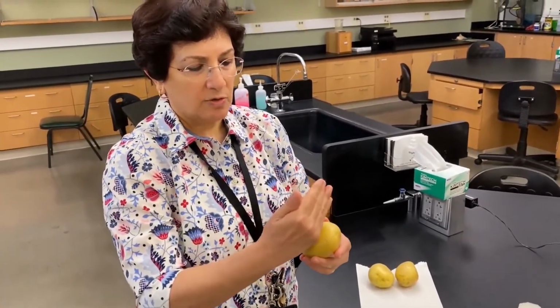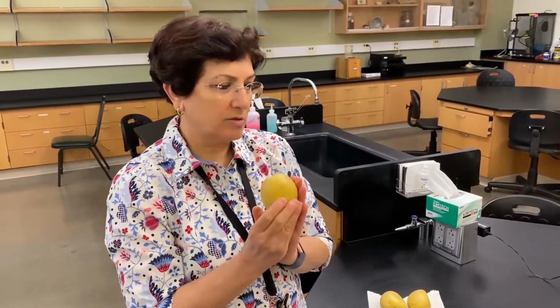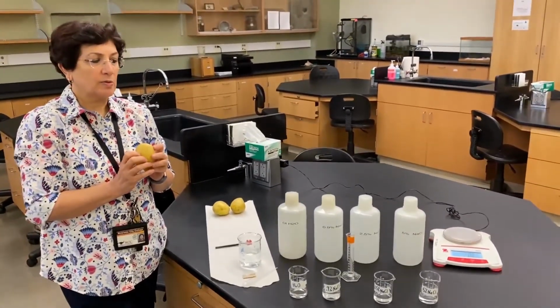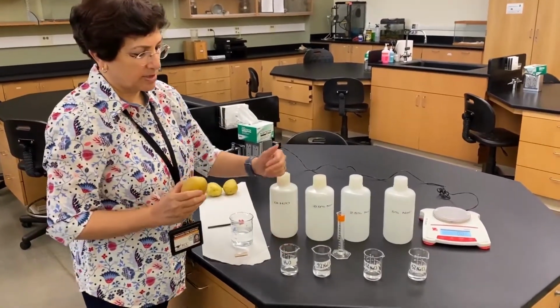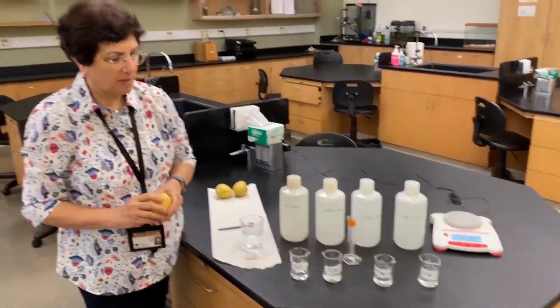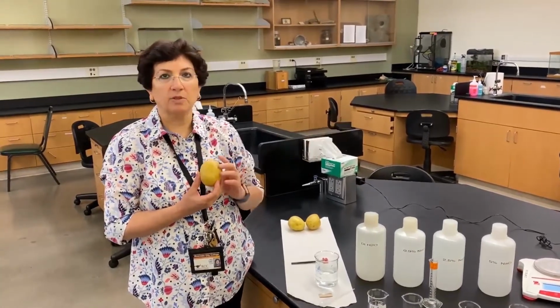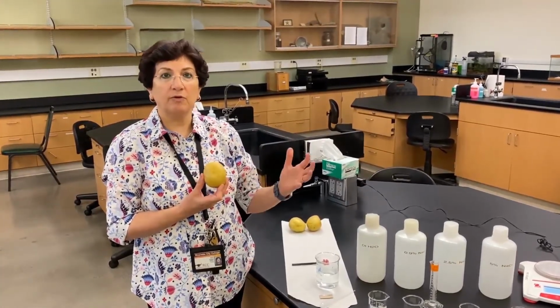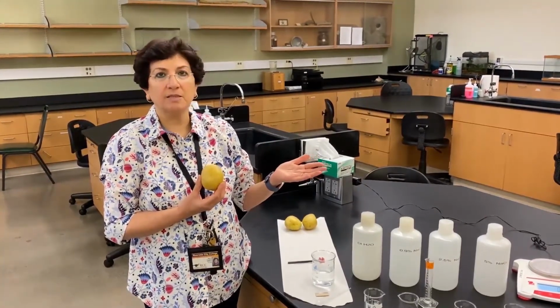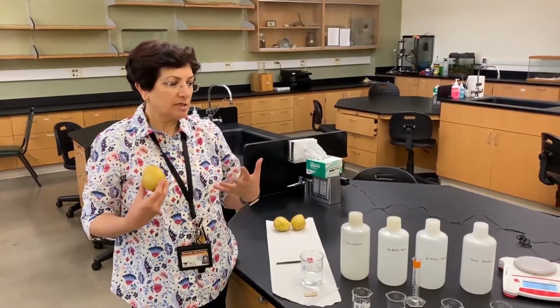And again, before I do that, let's come up with some hypotheses. So we're going to take potato and soak it in different salt solutions. So we have 0% salt, 0.9, 2.5, and 5%. When we think about our potato samples, we're going to start by weighing them. So we're going to record the weight before we put them in the solutions. We're going to let them sit for about 45 minutes, and then we're going to weigh those potato pieces again. So what do you think is going to happen?